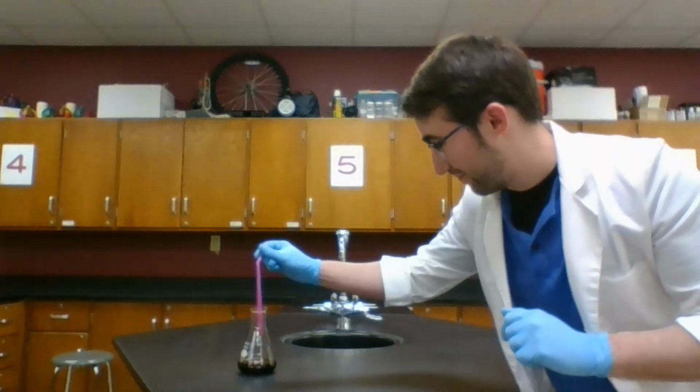Okay, and my indicator works by reacting and changing to a different chemical with a different color. I'm not blowing red into this. I'm not adding another color. My straw is not dissolving and giving off some color or something like that. Okay, the color seemingly comes out of nowhere because I'm making a chemical change. That results in a new substance with a new color.